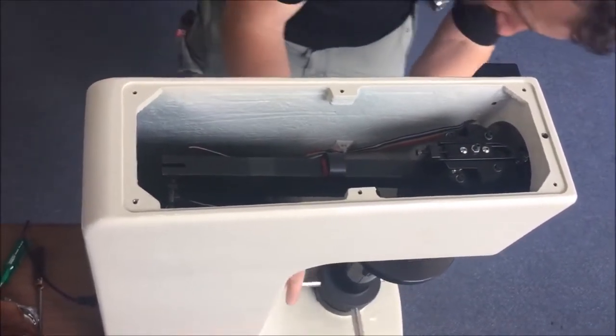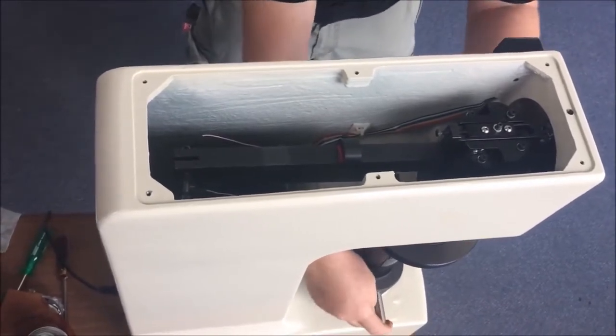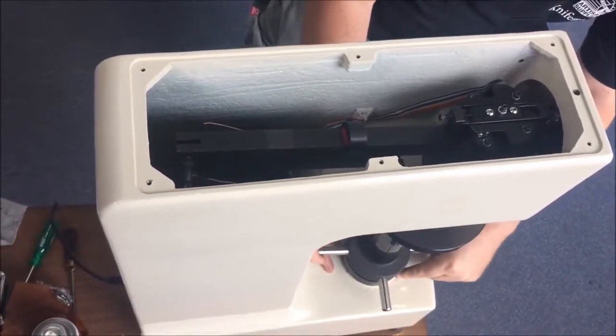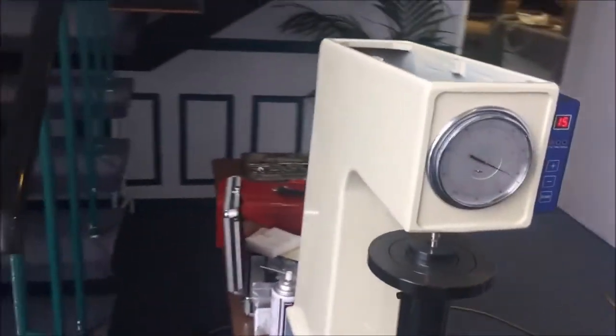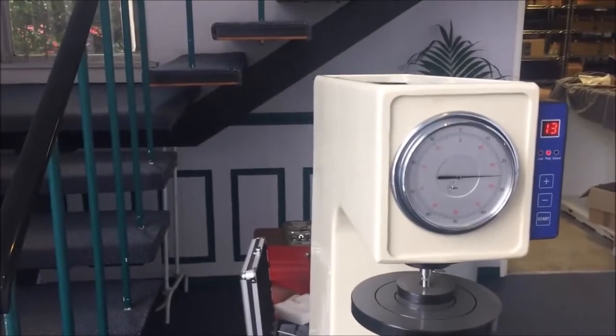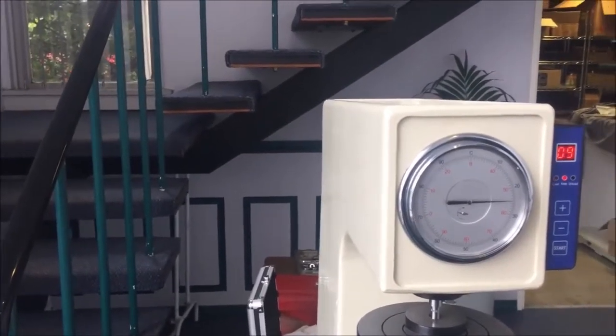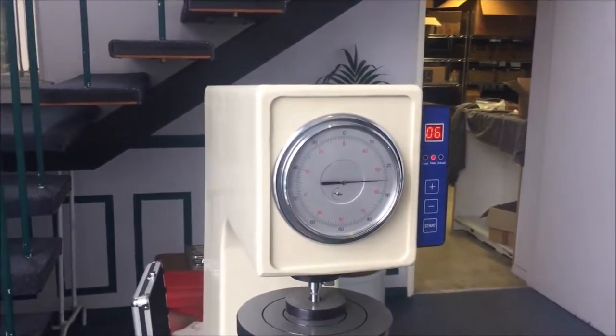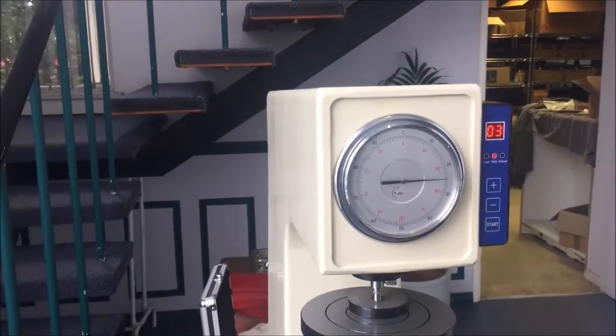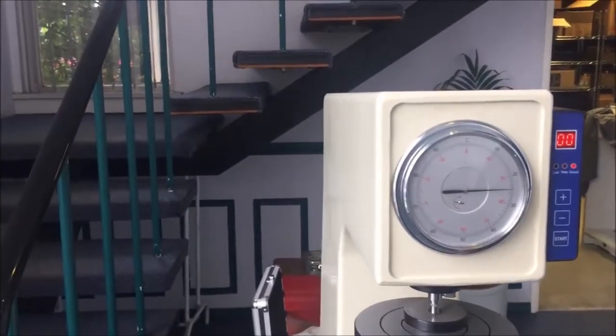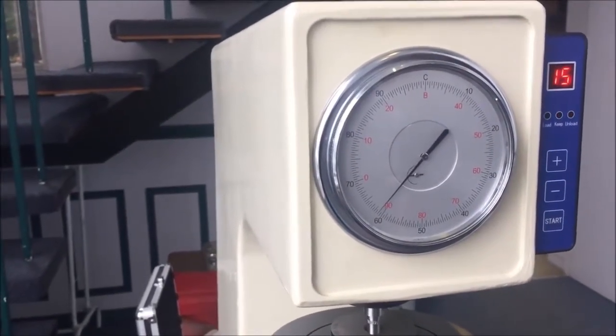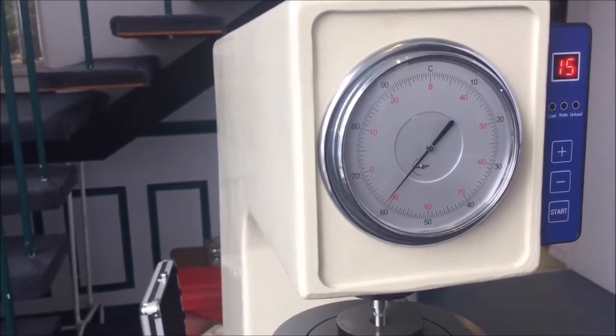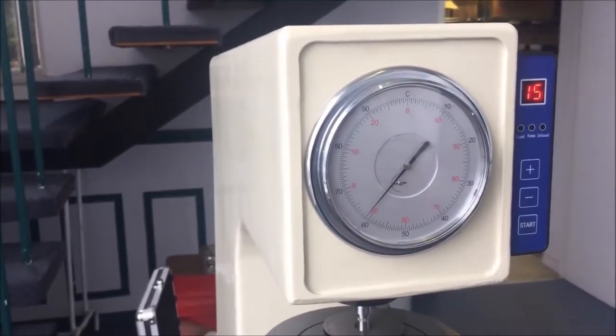Get our test block. Feels better now, by the way. Come around this side, we'll have a look how it reads on the test block this time around. Again, preload on the red dot. And it's reading 61.5, which is bang on exactly what it's supposed to read on that test block, 61.5.